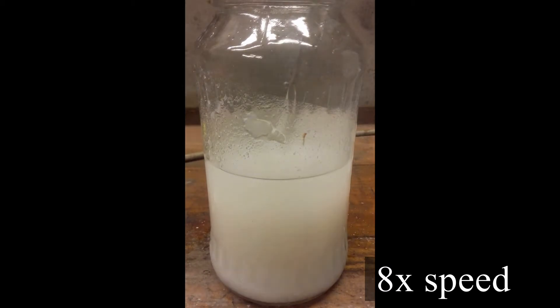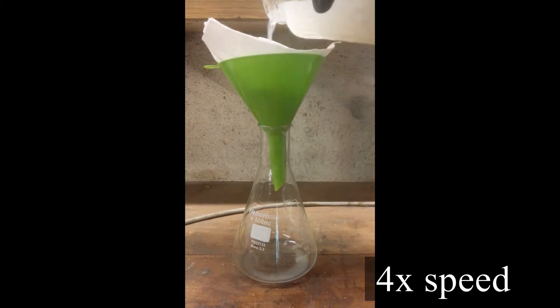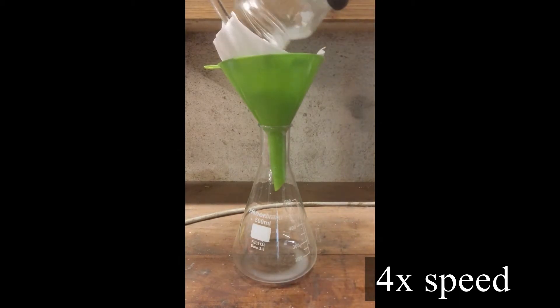Break up the lumps and make a slurry if you can. If not then it's fine, just filter the solution, wash it with water and let the solids dry. But if your filtration takes forever there is a quicker way.